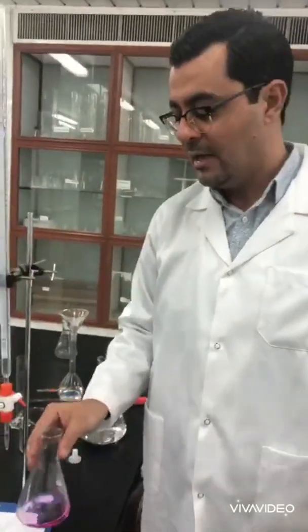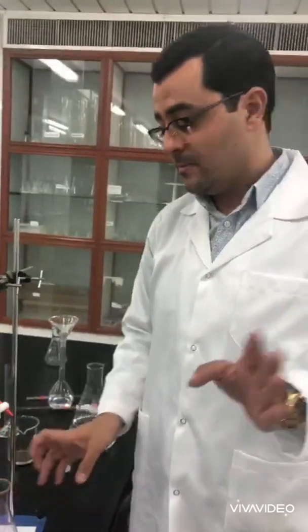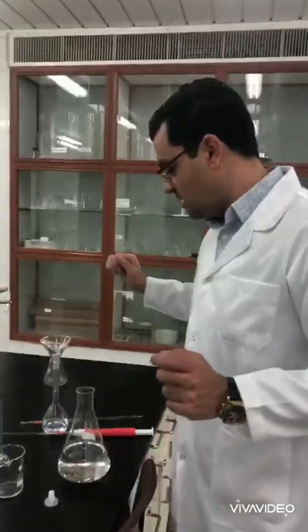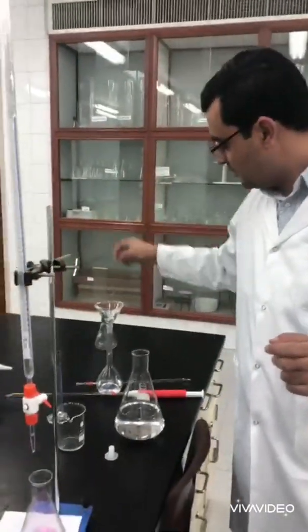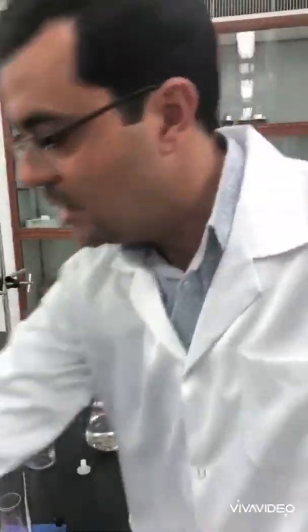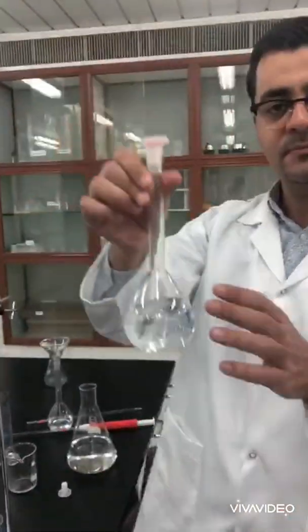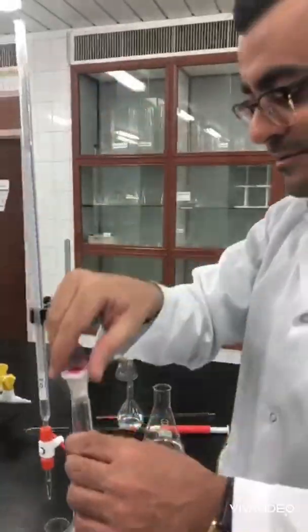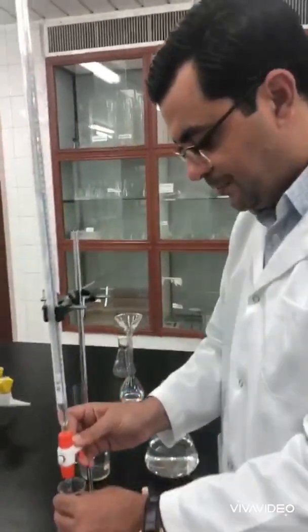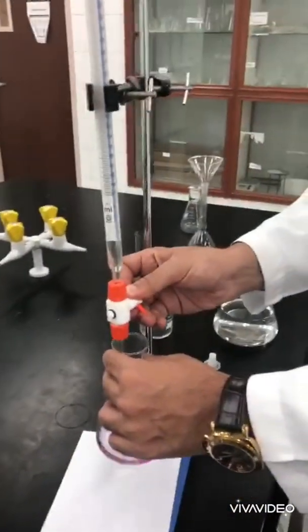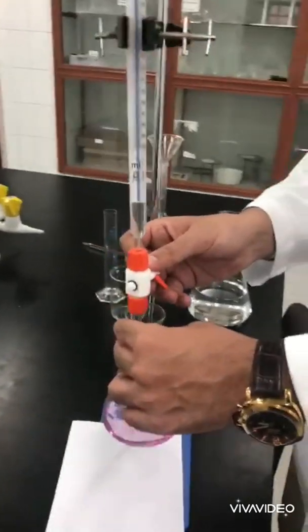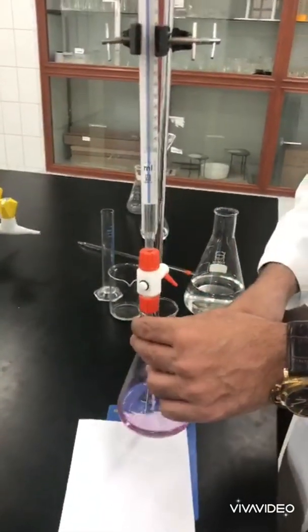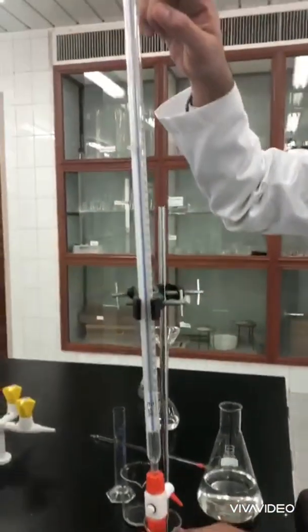Last step: I repeat the procedure, same everything, but this time using H2SO4. It's here. Wait for me. I am performing now the last step, the last part of this experiment.